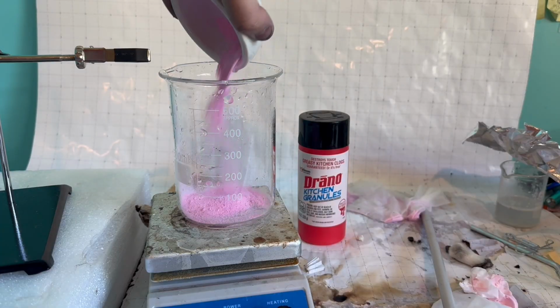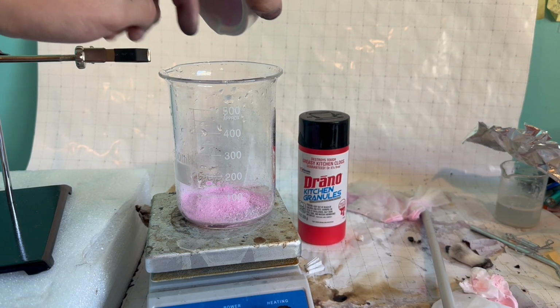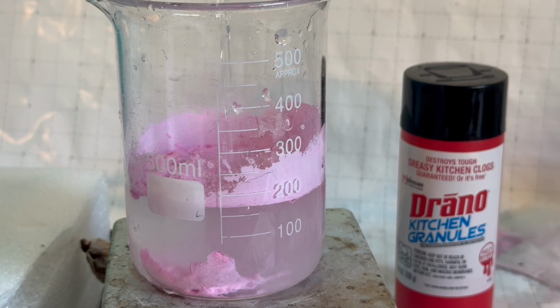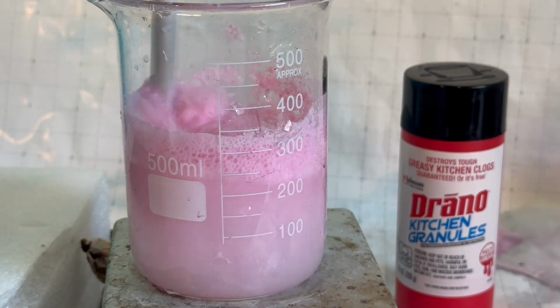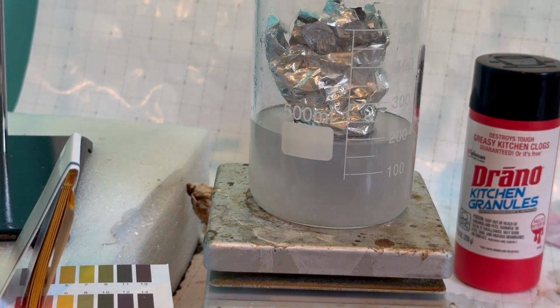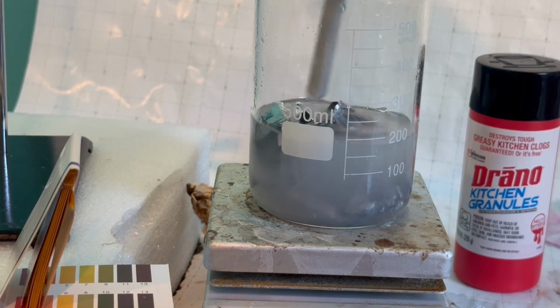For the third batch, I decided to powderize the bismuth tablets before adding them into the beaker. However, when I added water, most of the bismuth floated to the top, but some stayed at the bottom. When I added the acid, I thought everything would bubble very violently. However, it was more tame than I thought. After filtering the solid bits off, I once again added the aluminum. Unfortunately, after the aluminum was added, at one point there was a miscalculation and everything ended up on the ground.